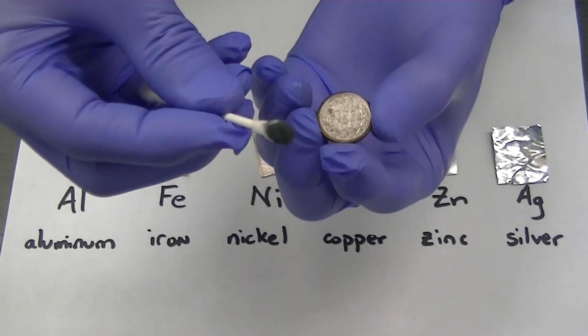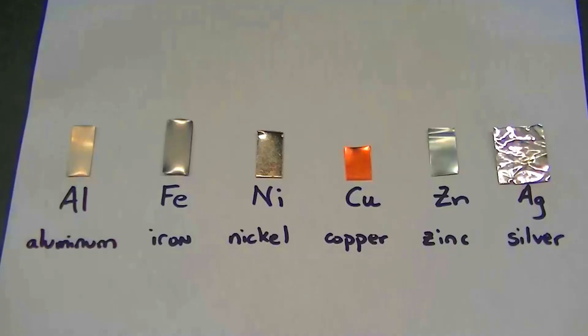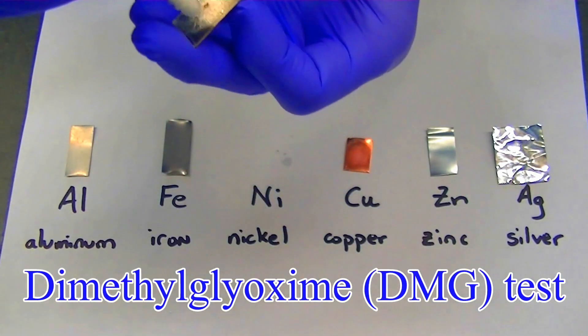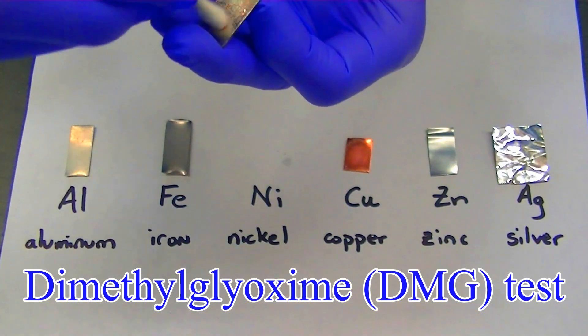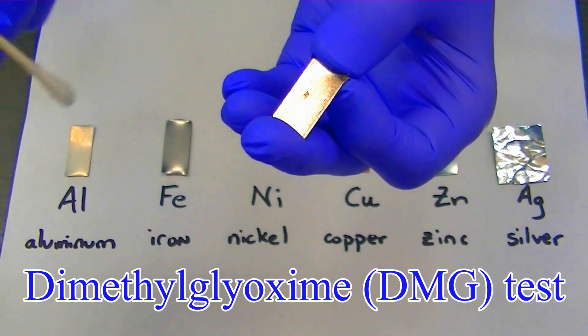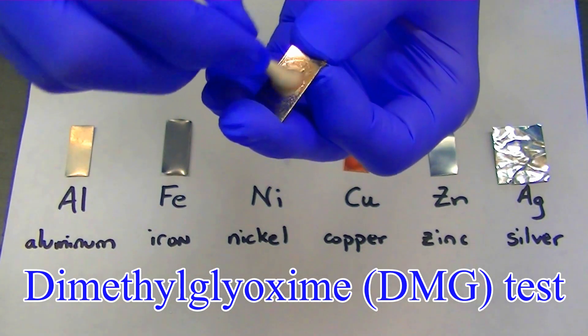The fact that the oxidized silver compounds get reacted away makes the silver sample appear quite shiny after this test.